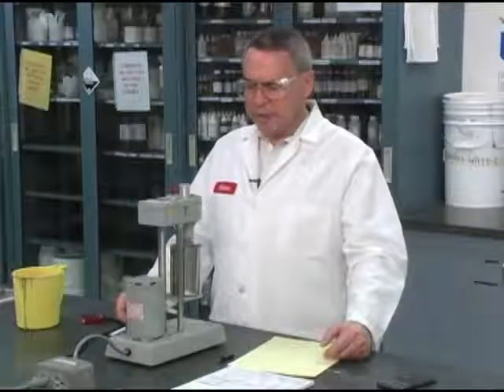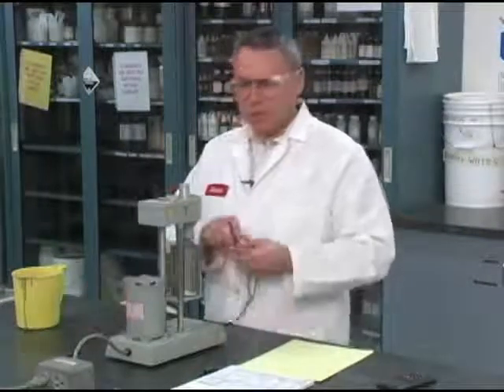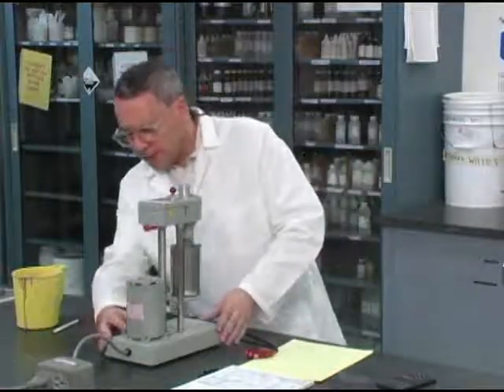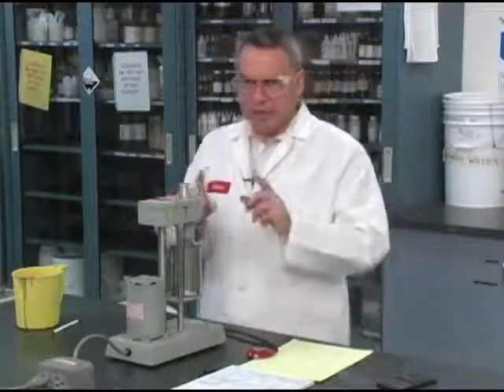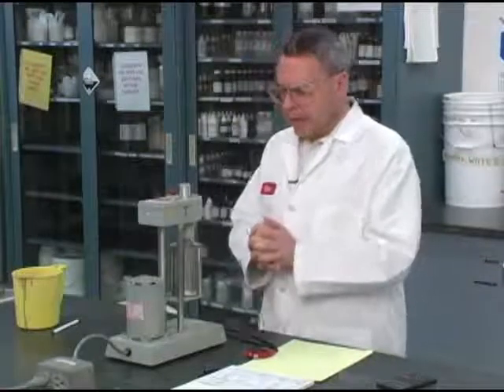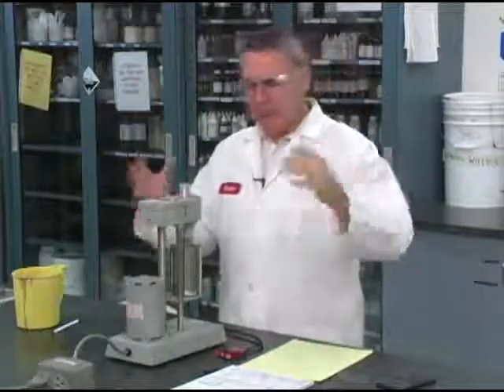One thing I'm going to need now is to measure the 10-second gel. So what I'm going to do now is change this, go to a high speed, switch to high, and go to this particular gear. So I'm rotating that, making sure that I break all the gels using a high or relatively high shear rate. And after moving this for maybe 2-3 minutes, I could probably take a little break and then come back.